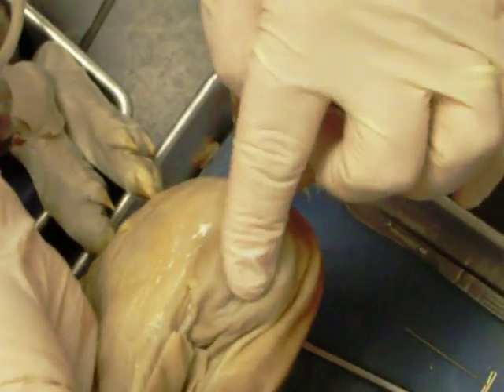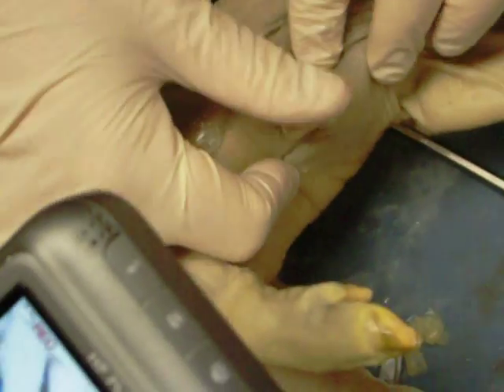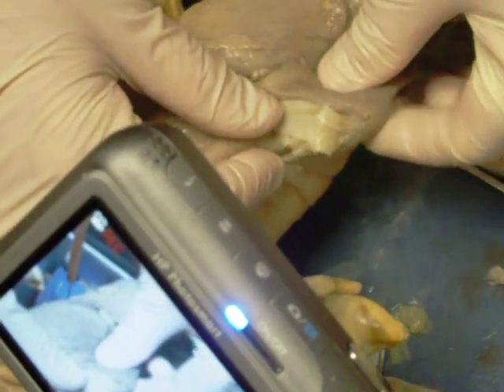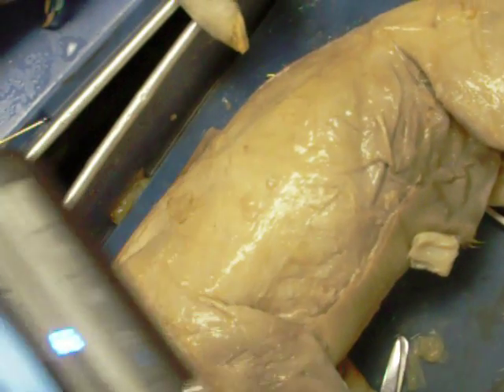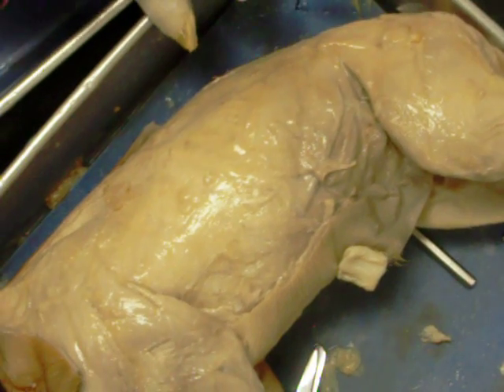On the male in the same region, we have the anus, the scrotal sacs, and the urogenital opening found posterior to the umbilical cord. Inside we have the penis right here. People look for external anatomy on that but they're not going to find it because it is a fetal pig — not sexually mature.